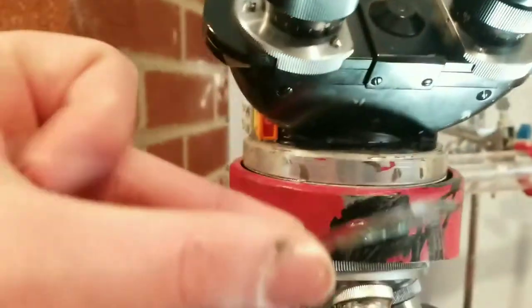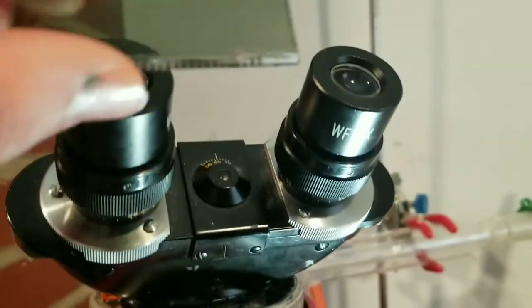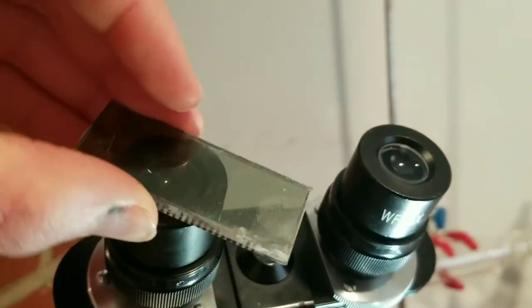However, you also need a polarizer filter up here, and originally I was going to use them on each eye cap. However, my original plan has been foiled since my source of polarizer filters, 3D glasses, all movies are shut down in my city because we're on Corona lockdown. I was going to go see a 3D movie like Cats 3D or something. Unfortunately, I'm going to have to use these ones from old electronics.